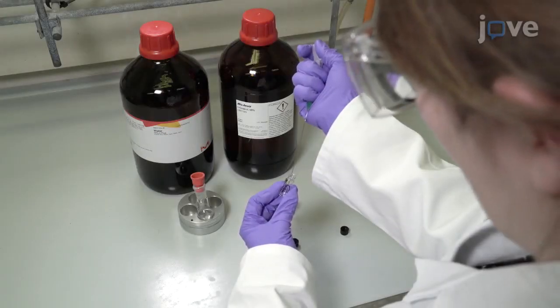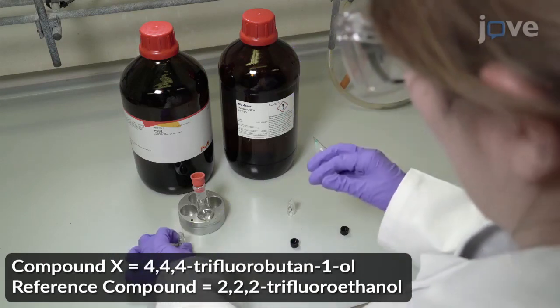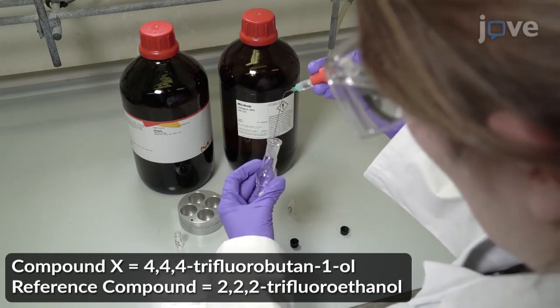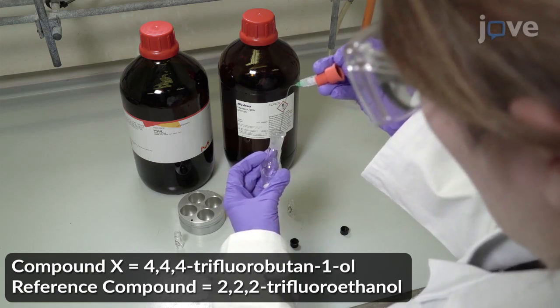Add 6.0 milligrams of compound X and 3.0 milligrams of the reference compound to a 10 milliliter pear-shaped flask. Dissolve the compounds in approximately 2 milliliters of HPLC grade N-octanol and add 2 milliliters of HPLC grade water.